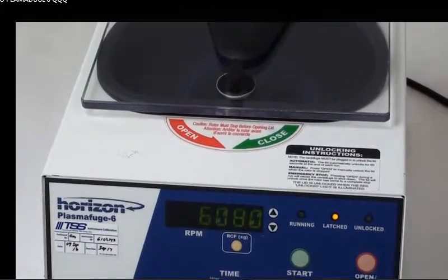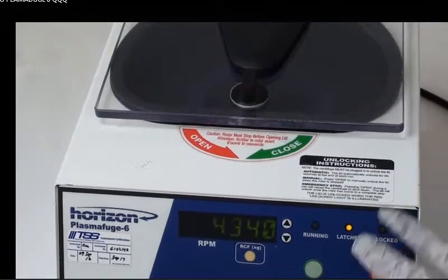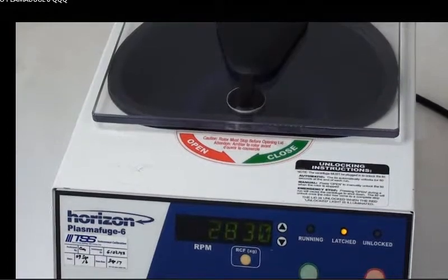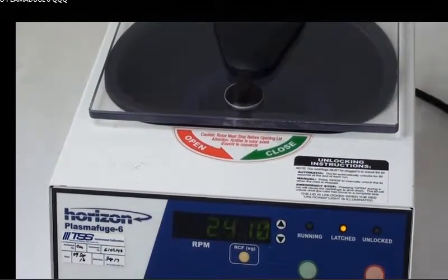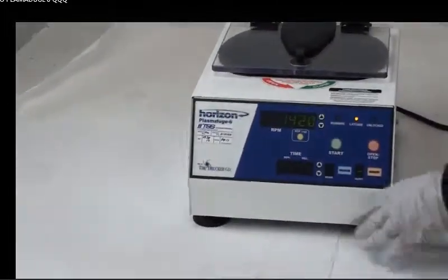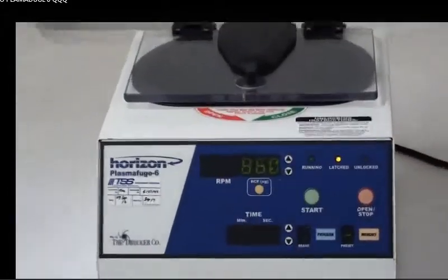Now it's decelerating and you can adjust all of these components. I'm going to show you that after we open the latch. I'll have you step back a little bit. We'll wait until it completely goes back to zero and then we can open it and I can show you the inside tubes.